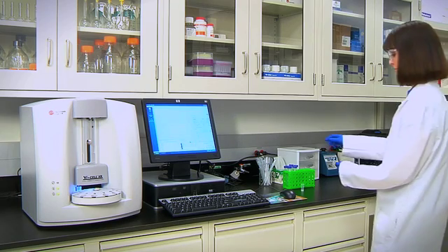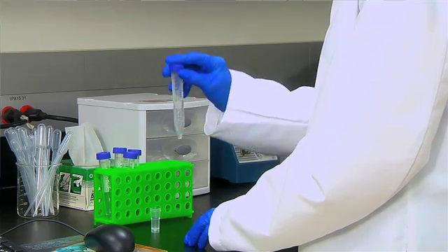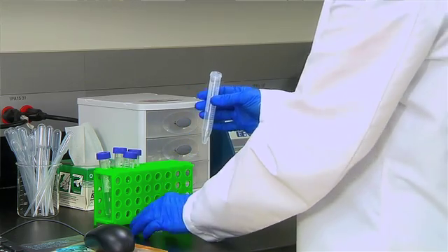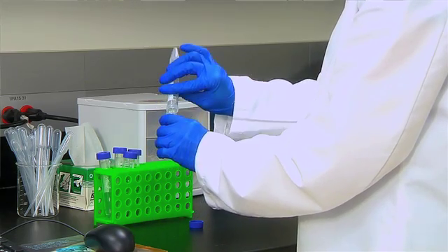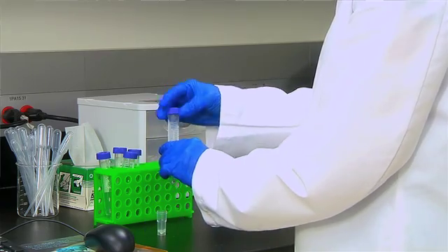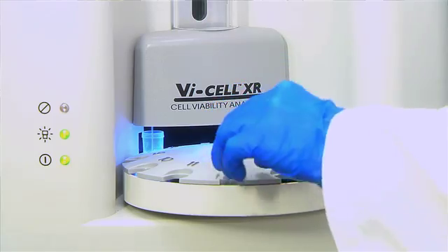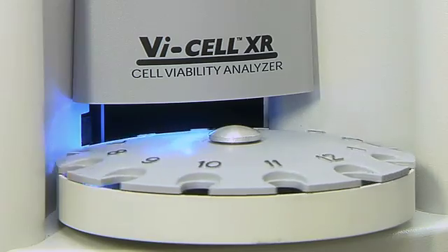Now we'll demonstrate how easy it is to operate the ViCell XR. First, pour a minimum of 0.5 milliliter of sample into the ViCell cup. The ViCell performs all the sample preparation, so there's no need for accurate manual pipetting. Then place the cup into the carousel — a 12-position auto sampler which allows continuous feed.